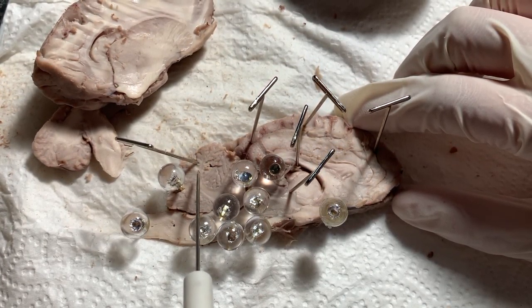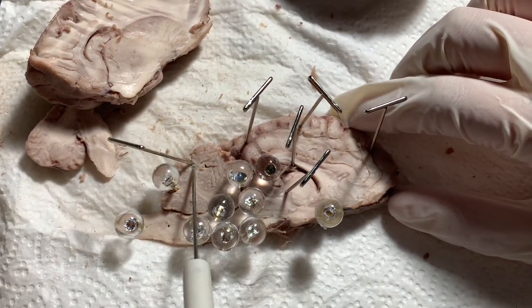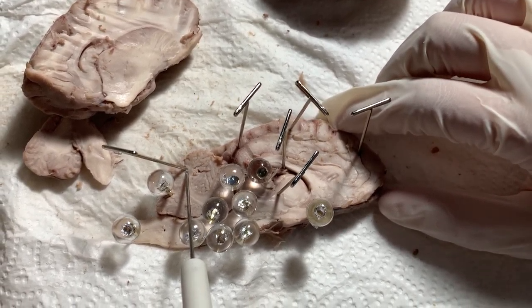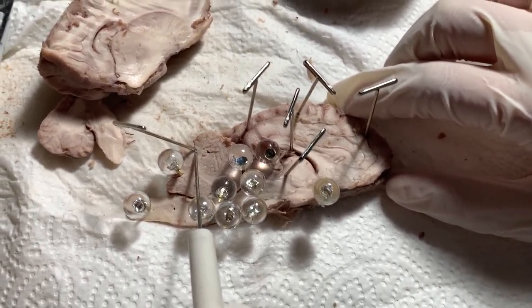Next we have the cerebellum. The cerebellum's objective is to coordinate the voluntary movements.